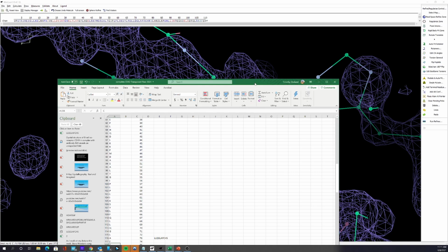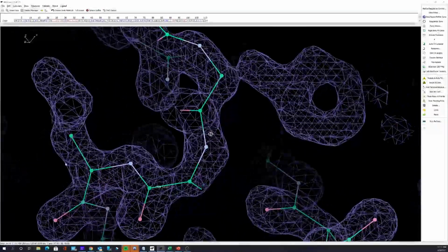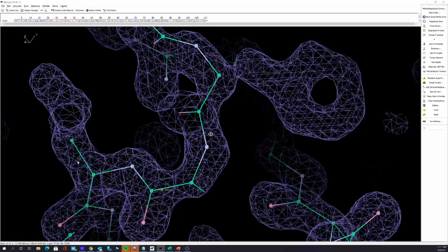So that's why I had to go through and check everything about what he was doing and found that the sequence was wrong. So I've included the correct sequence with 2021, and I've added a FASTA sequence just in case I made a mistake again. I don't think so, but it's always possible. Okay, so what did I do? Well, I basically went back to this region here, and I changed the sequence and then fit the electron density. So let me do that right now.